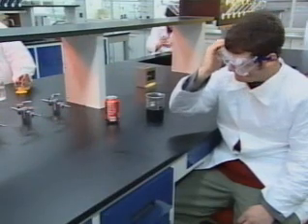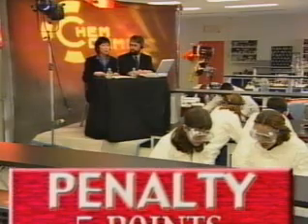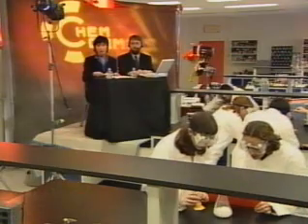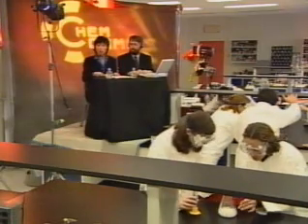This place is no place to be eating or drinking anything. These chemicals can kill you if they're ingested accidentally. Fortunately, they aren't working with any toxic chemicals today, or this could have been more serious. It will put them out of the game, and it will hurt the team with the judges at least. Yep, I have just received a note. The judges have penalized Roosevelt 5 points. Looks like he'll be on the disabled list for a while.